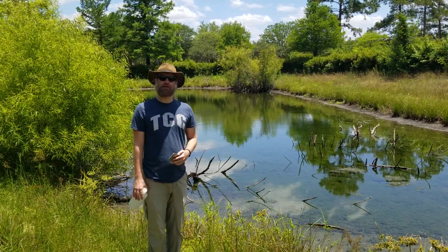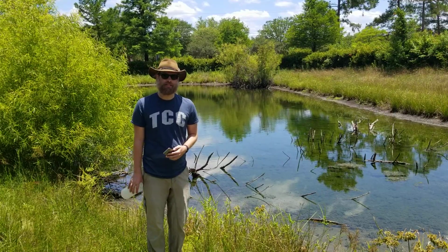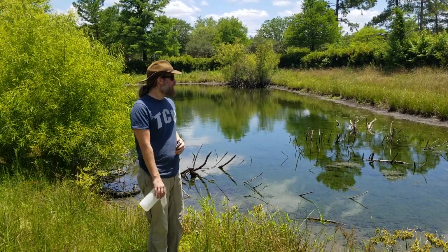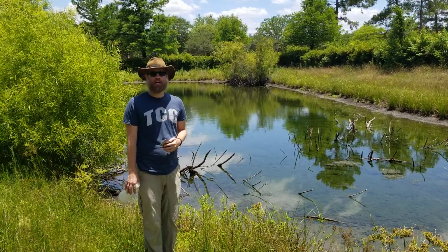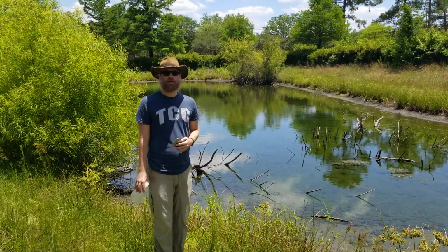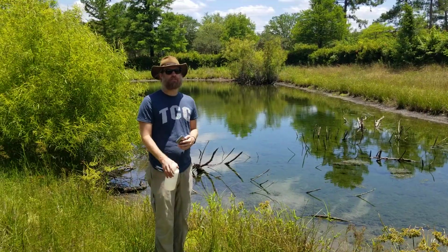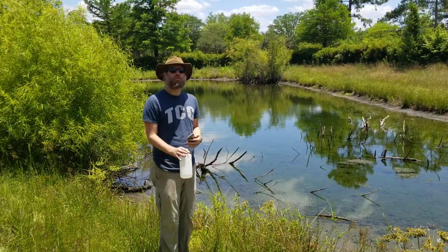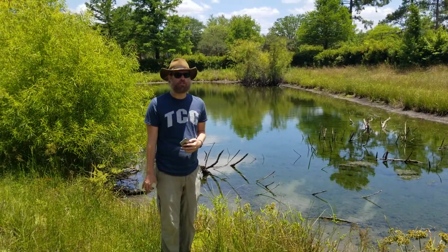So this is the second video in our series of videos about our aquatic ecology investigation in BSc 2011 lab. What we're going to do first when we sample the pond is take some abiotic characteristics, water chemistry, as well as turbidity. Turbidity is a measure of the amount of sediment in the water, or how murky the water is. So we want to take this first so we don't disrupt the pond by sampling the organisms before we measure turbidity.